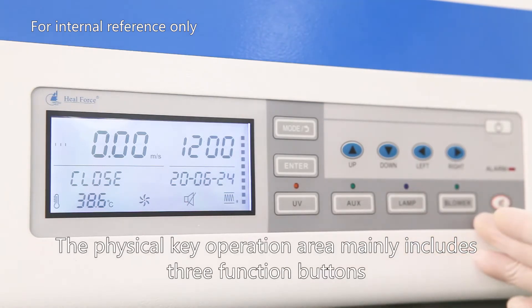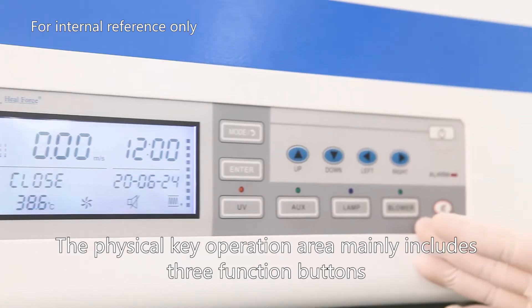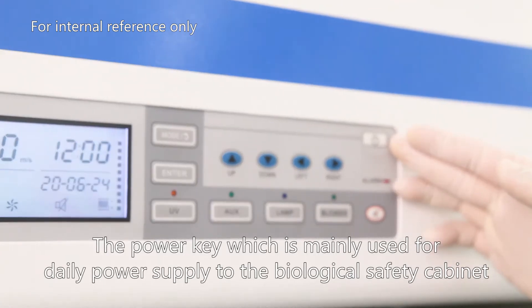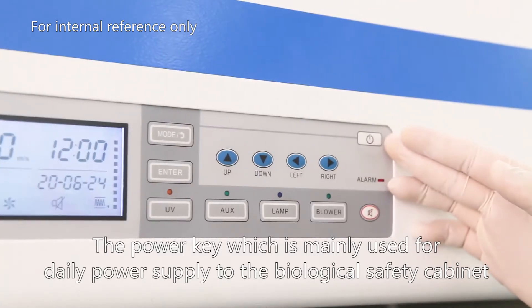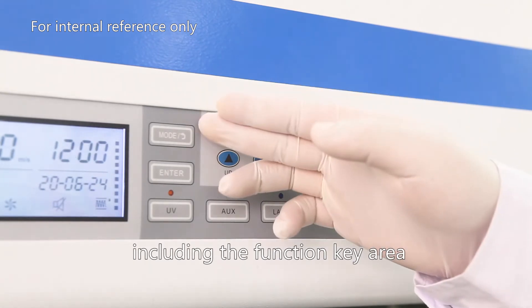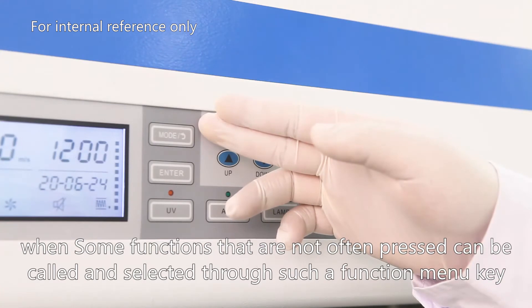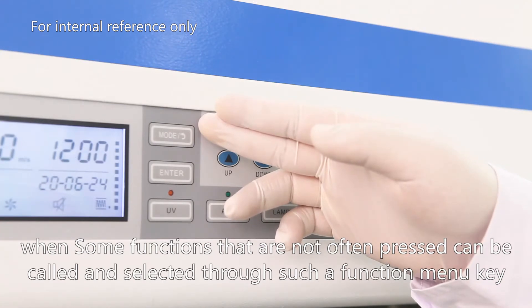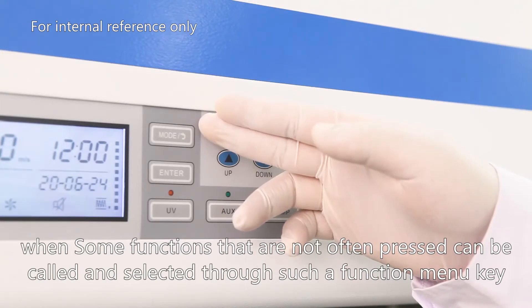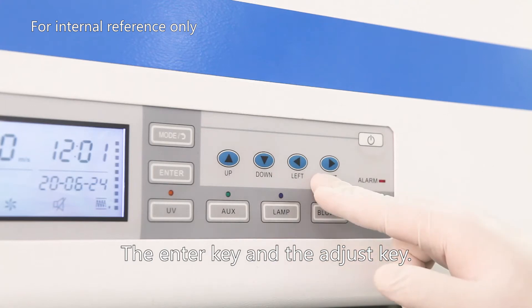The physical key operation area mainly includes three function buttons: the power key, which is mainly used for daily power supply to the biosafety cabinet, including the function key area where functions that are not often used can be called and selected through the function menu key, the enter key, and the adjust key.